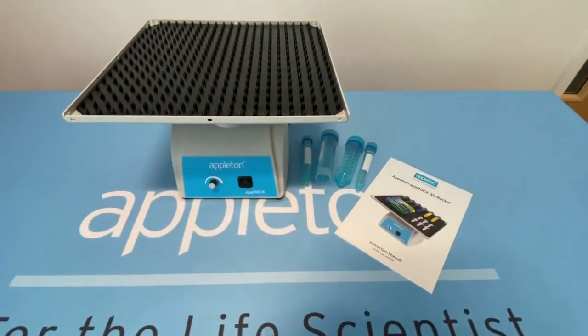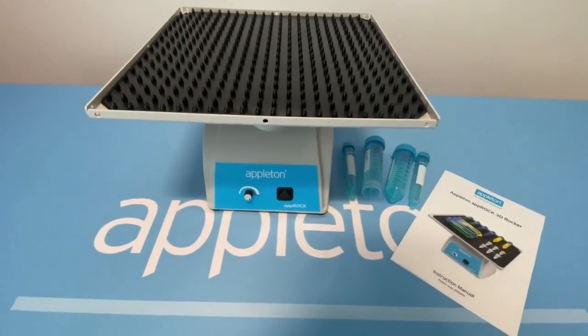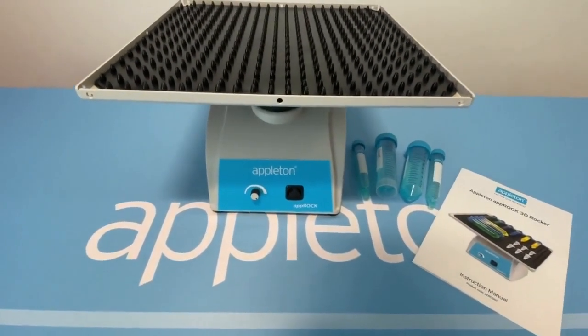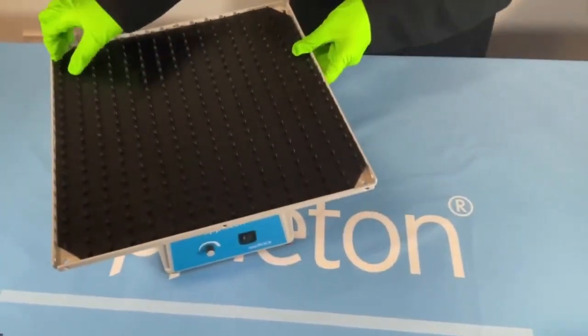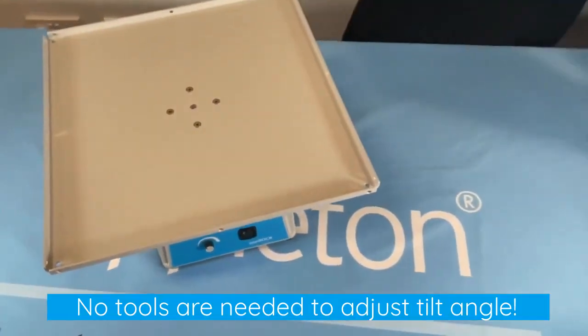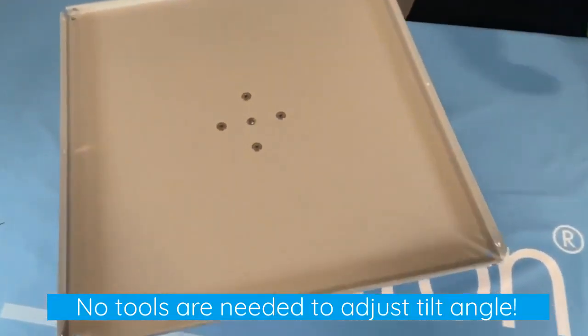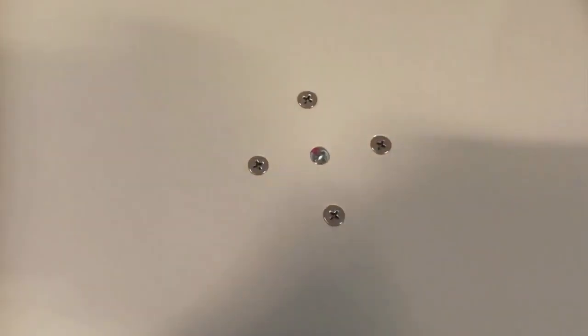The AppRock 3D Rocker provides a large platform that's easily tilted to suit your sample container sizes. To adjust the tilt angle, remove the mat from the platform. Locate the red mark on the center screw.